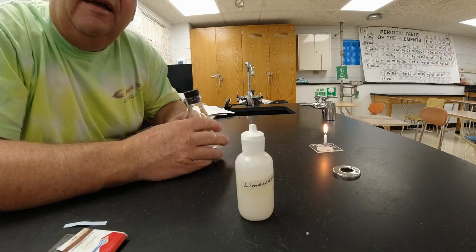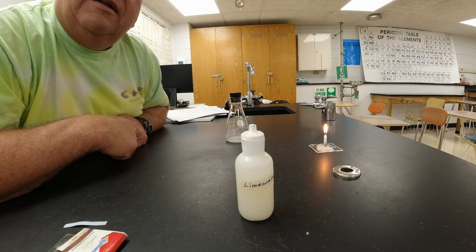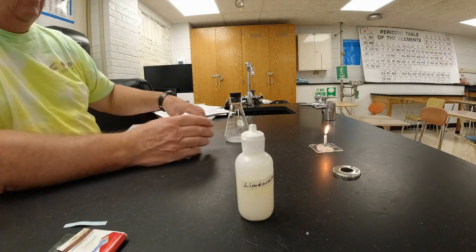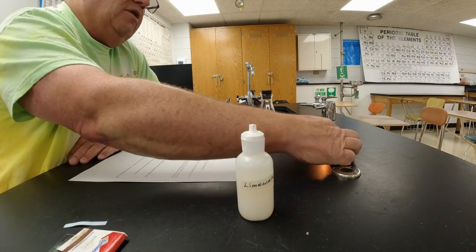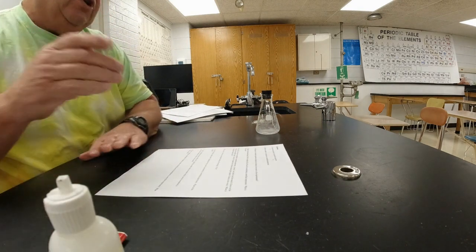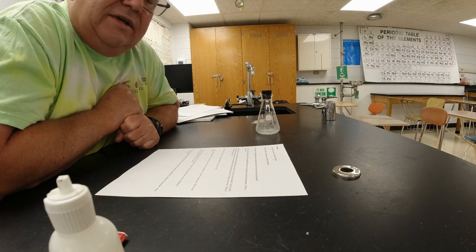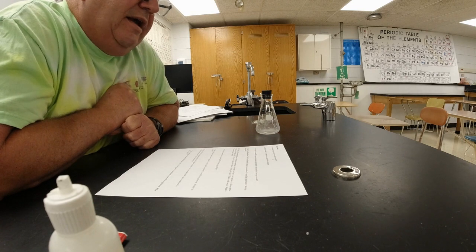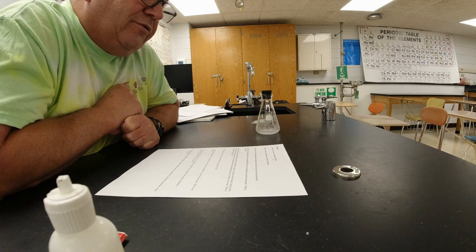All right, again, pause this if you need to. This is kind of the end of the video, what you're going to do. But let's talk about some of the questions that you're going to have in here. If you look at the questions on the conclusion, it kind of tells you what are the two parts of a controlled experiment. I'm going to blow the candle out. If you listen to the beginning of the video, I told you what the two parts of the controlled experiment were. I told you what the difference between those two is called. I told you one of them gets this difference and one of them doesn't get the difference. That's what you're doing for number 3.